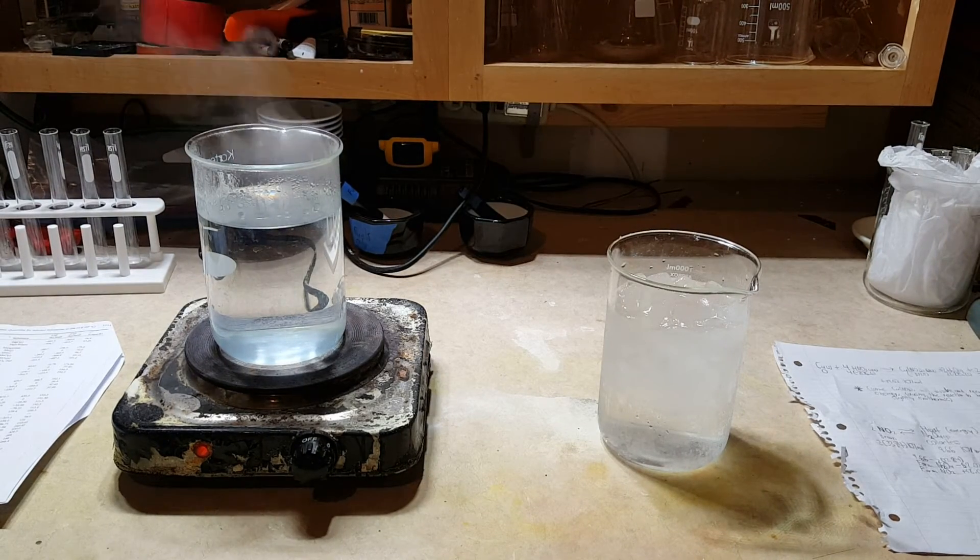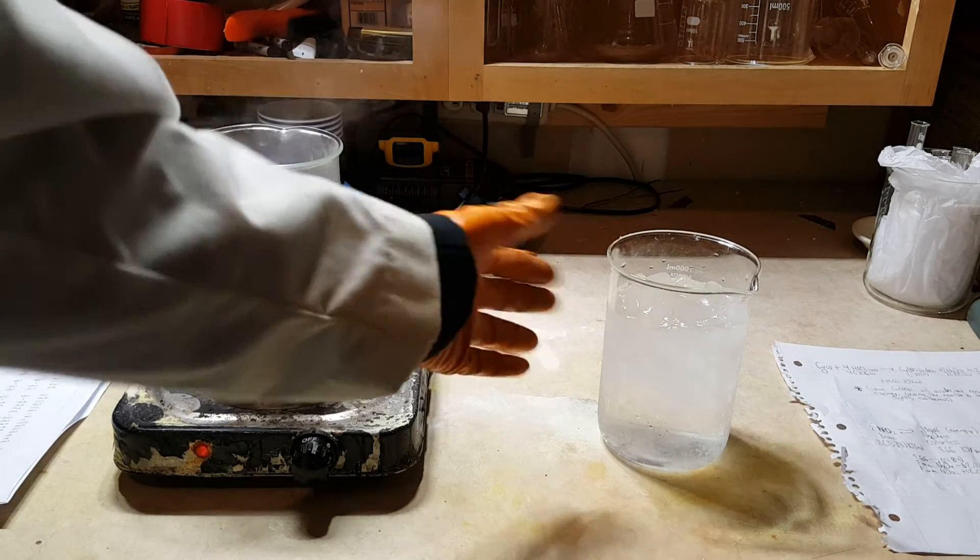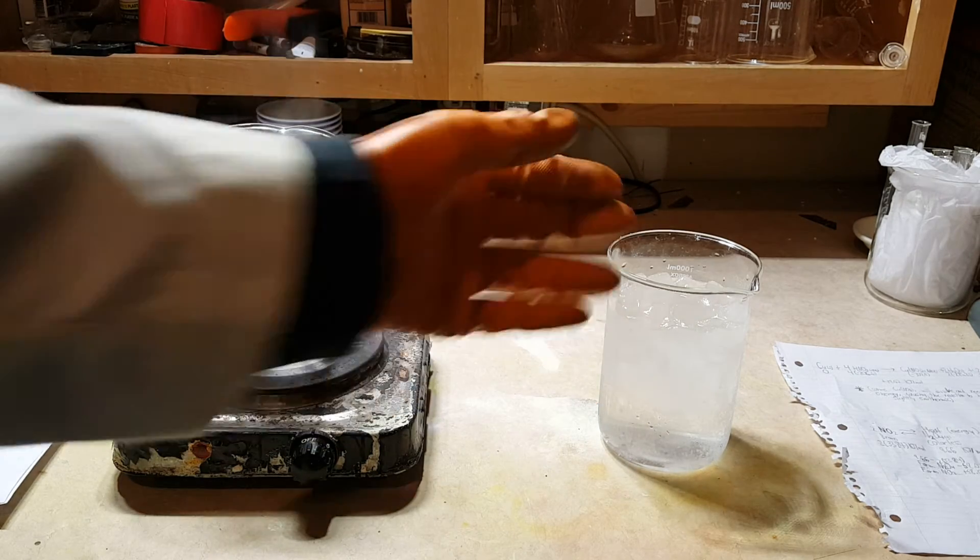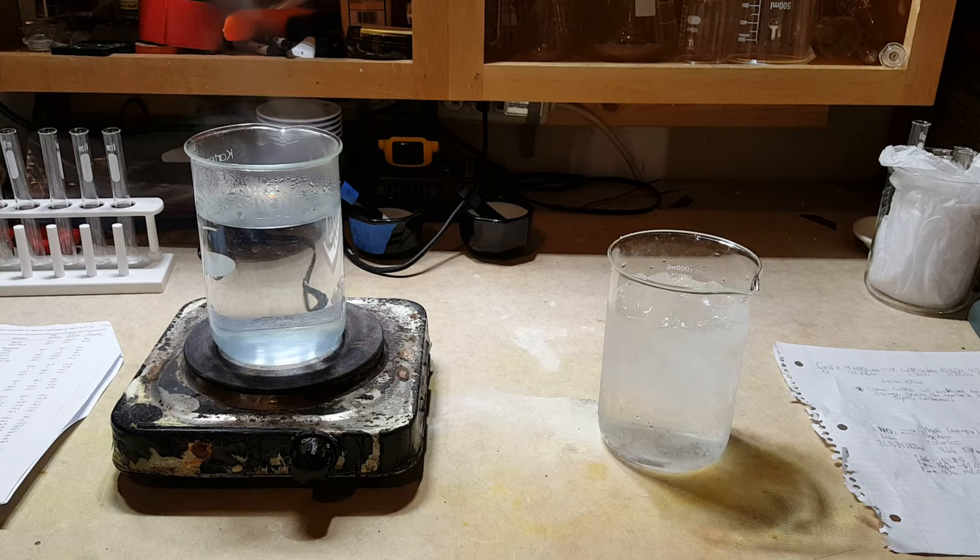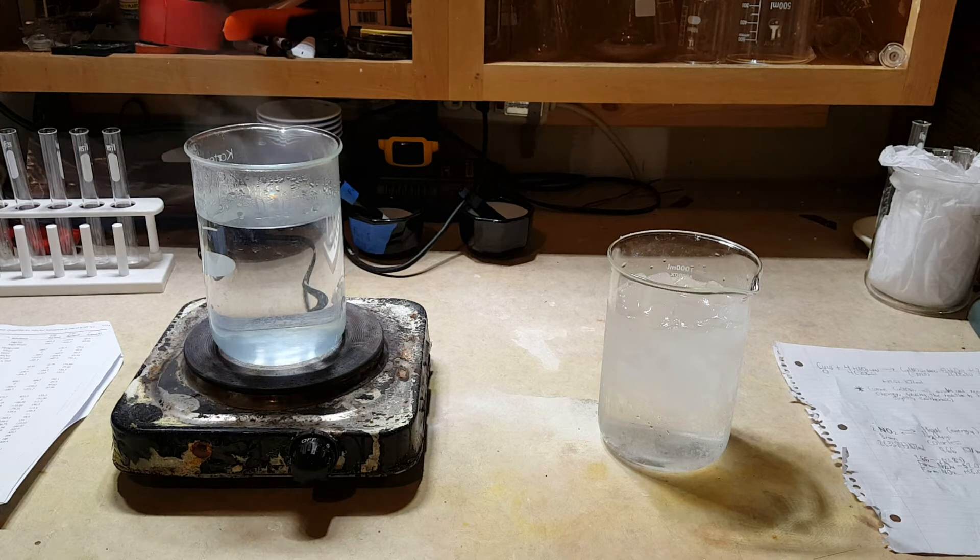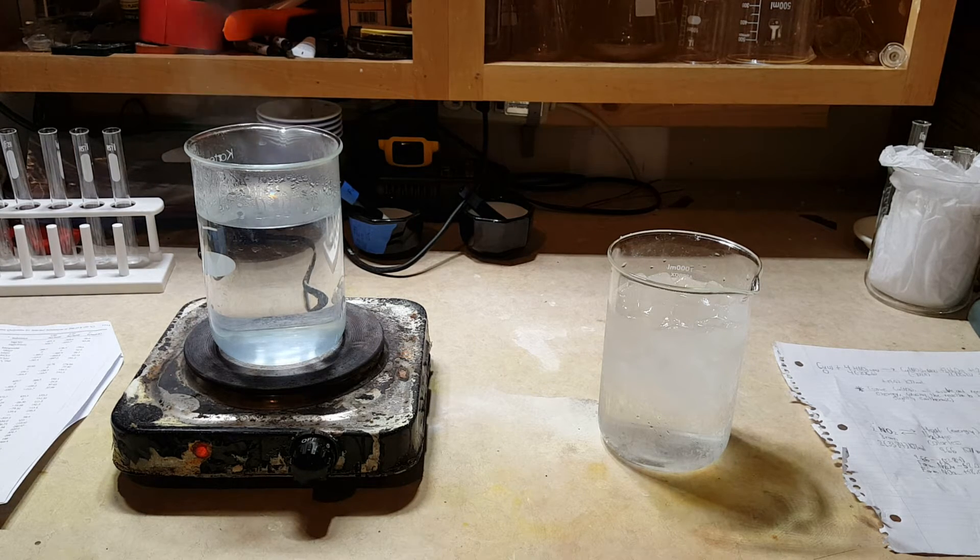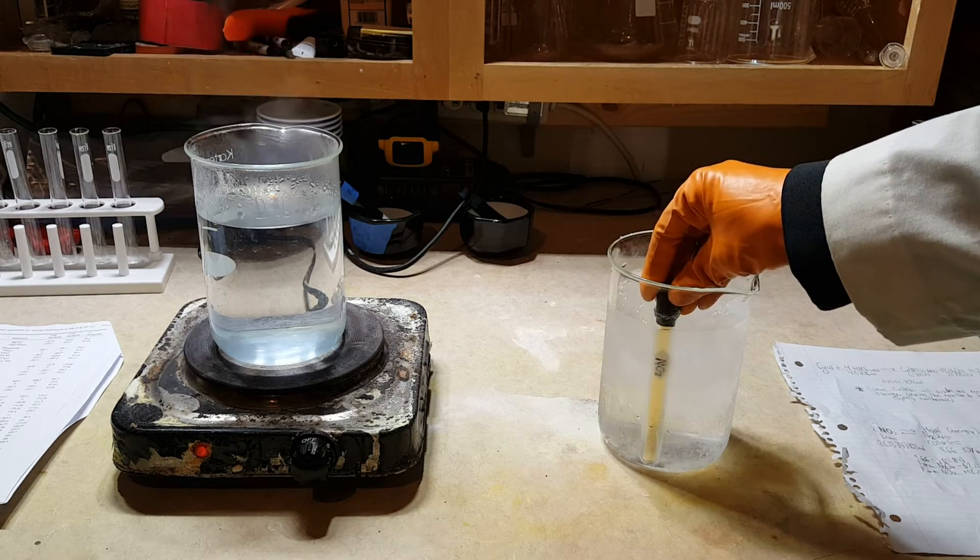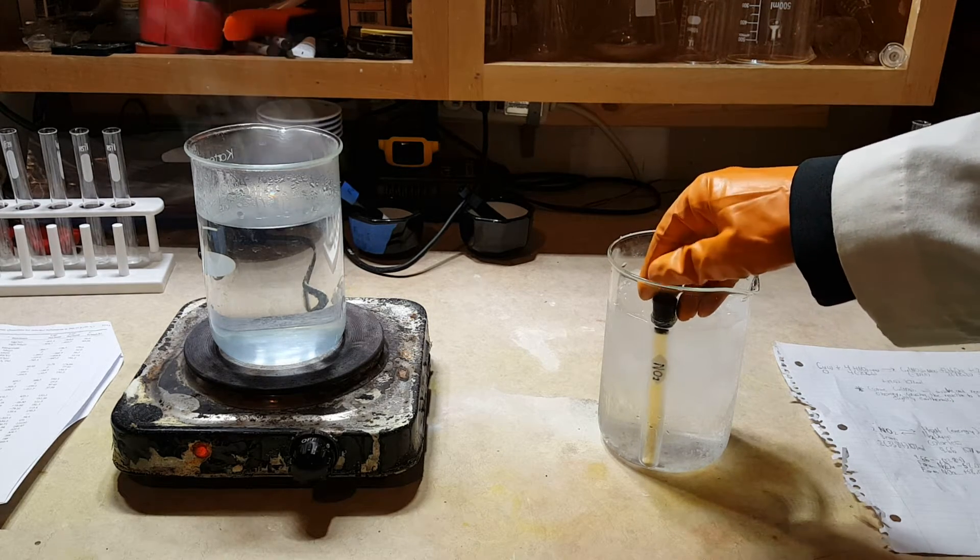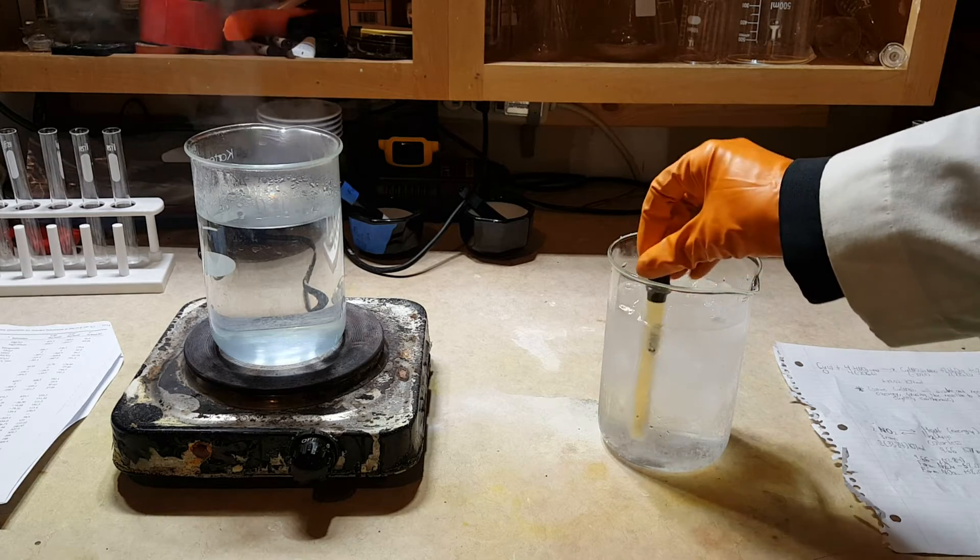So we've got a beaker full of ice water right here to take energy away, and we've got a beaker full of hot water here to add energy. So let's change our equilibrium. Let's cool it down first. Alright, let's give that a moment to cool.